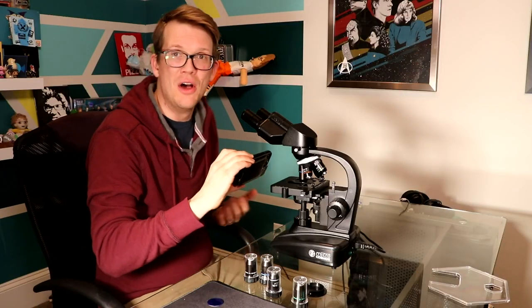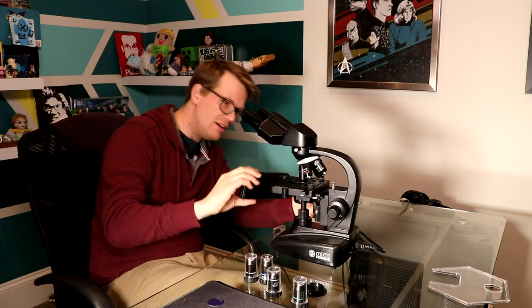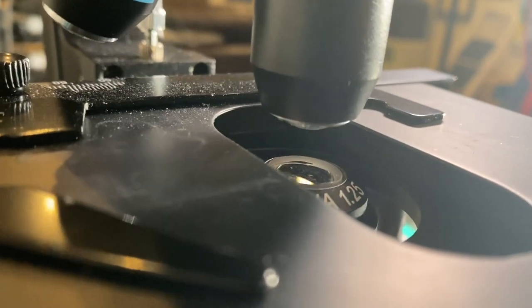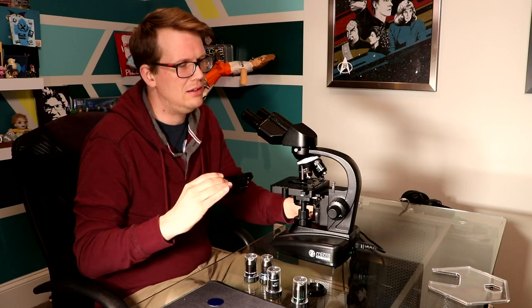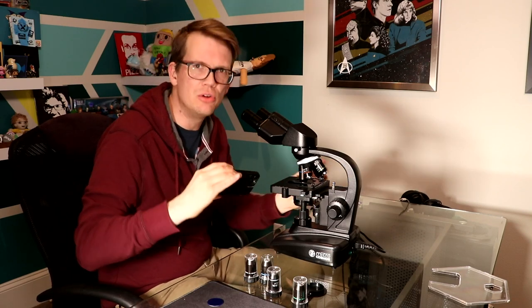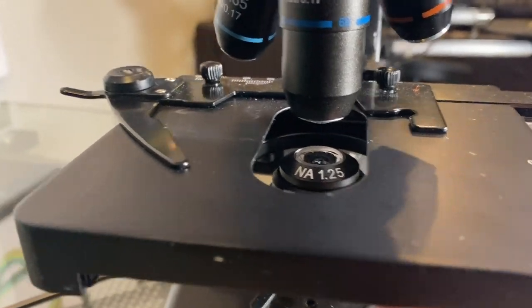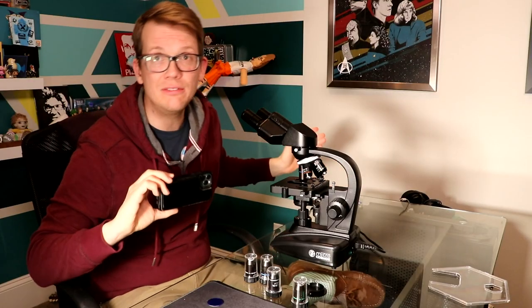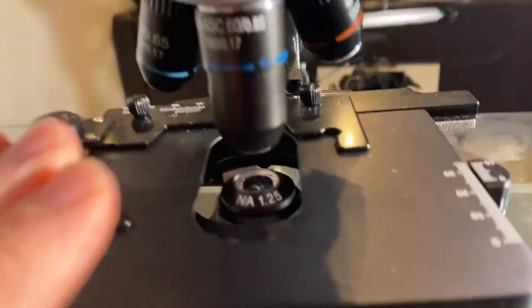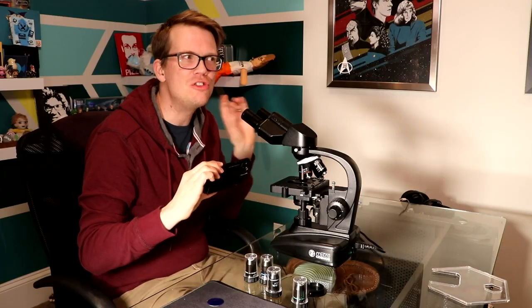And then you've got this little knob which moves the light source up and down. This is called the condenser. This moves the condenser up and down — there's sort of a sweet spot I've found. When I'm looking at an image, I move this up and down and find what looks good. Over here we've got your focus knob. This is on both sides, but you're going to want to use the left-hand side mostly. This is for fine focus; this is for gross focus. One thing to be careful of: focusing moves the stage up and down, and you can actually move it up into the lens. Just know that it might happen.